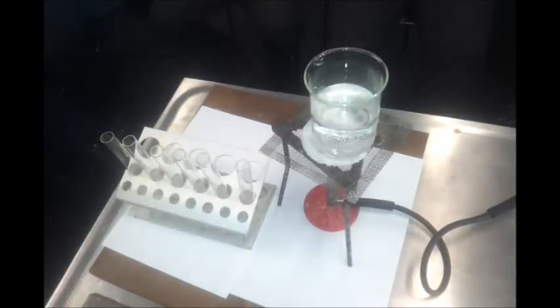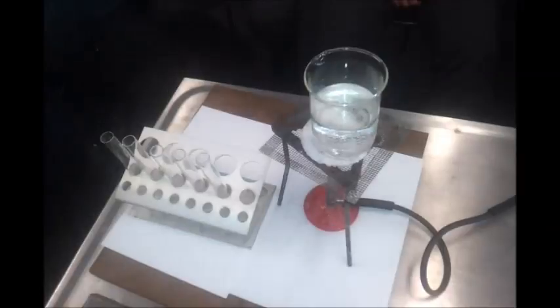Okay, what we're going to look at here are just a couple of really simple reactions and properties of alcohols. I'm going to use ethanol to show you what happens with a few things, and then I'm going to look at a primary, secondary and tertiary and see if there's any difference with them. So here I've got some ethanol, and I'm going to add some cold water to that and see if it looks like it's one layer or two.